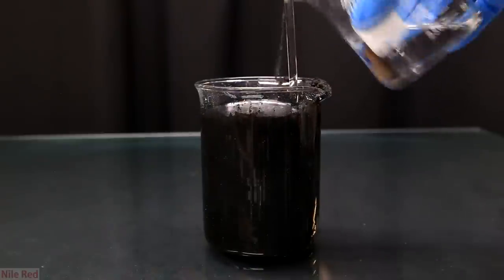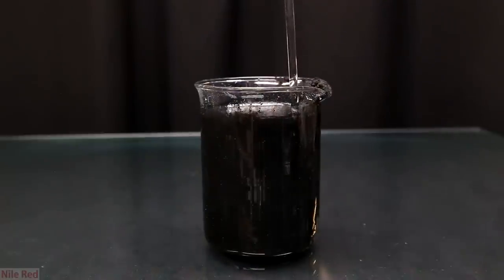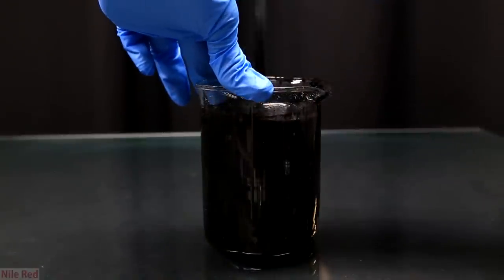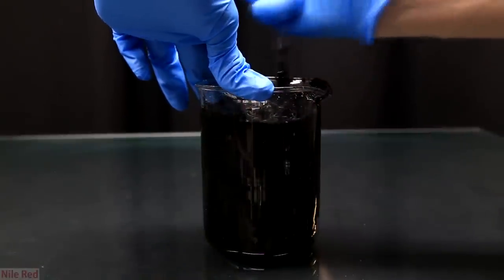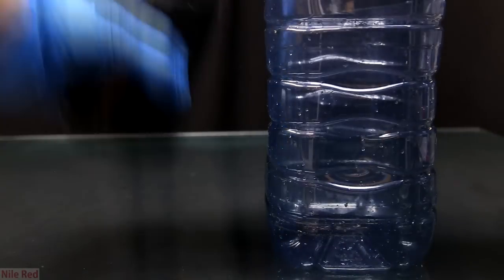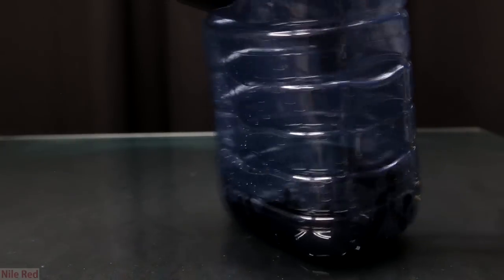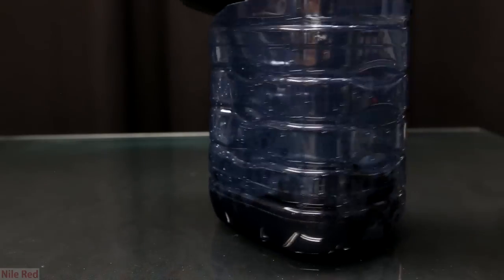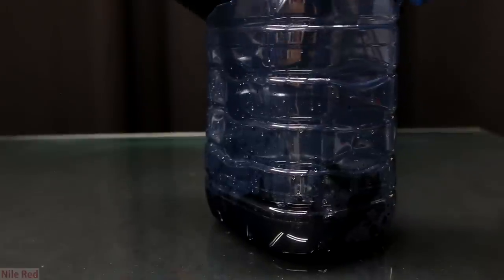I kept trying to add water in hopes that it would liquefy more but this was a dead dream. I knew at that point that I had to move on and use a larger container. I cut open the water jug that I used earlier to clean the zinc and the carbon and I poured in all of my manganese dioxide.